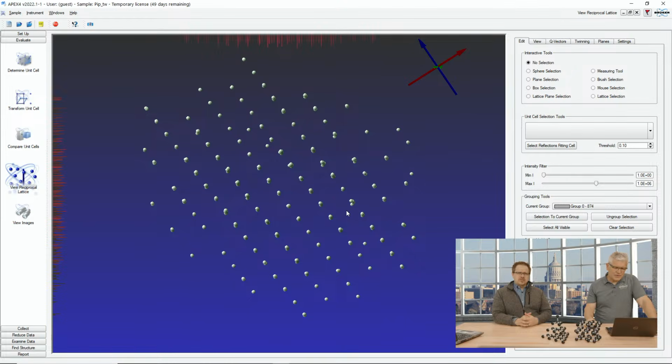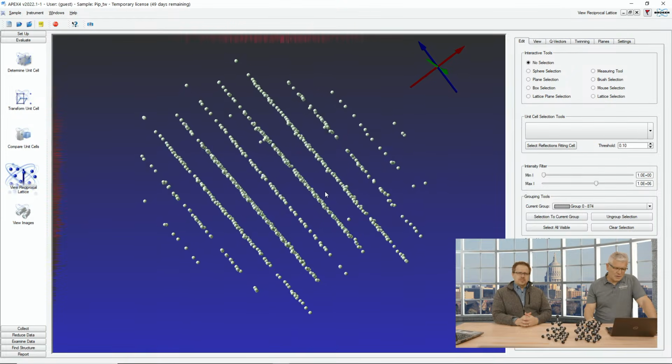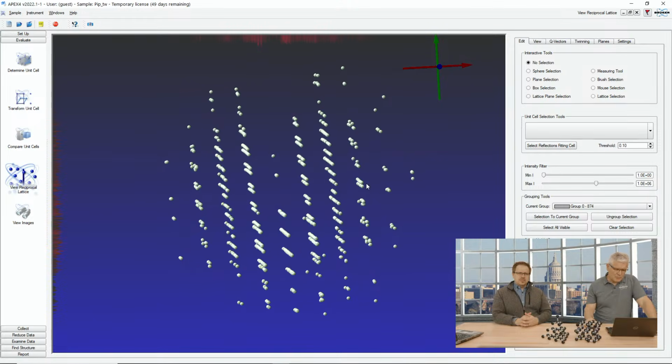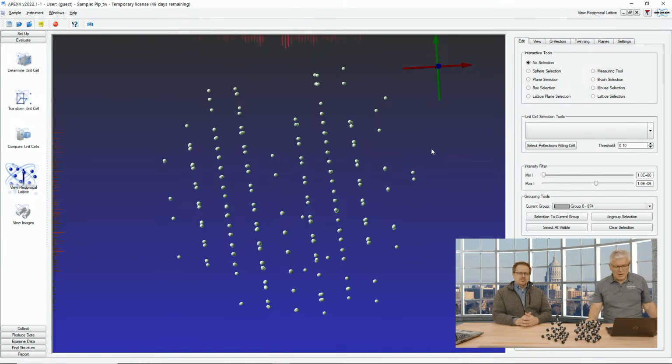Here in this direction, everything looks fine. And then we have other directions where we see these funny patterns, and if you remember that second example in my PowerPoint presentation, that looked almost similar.